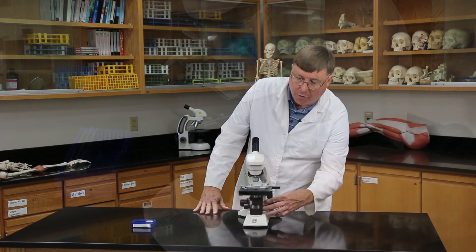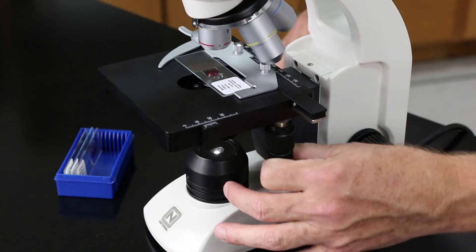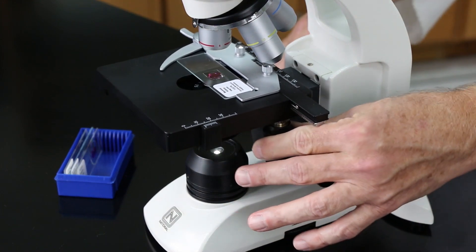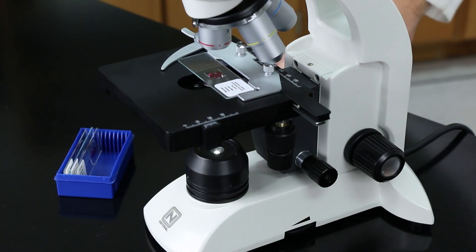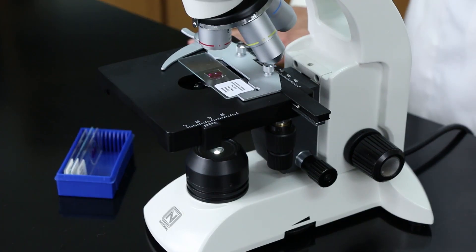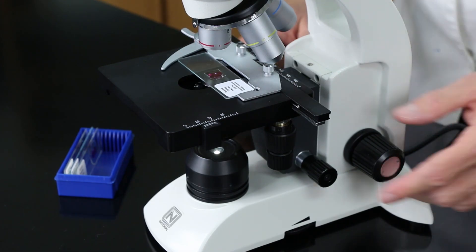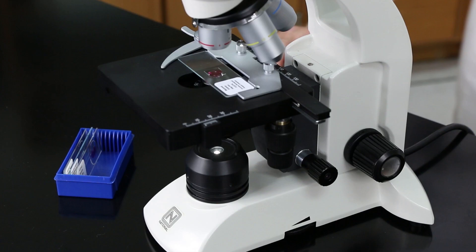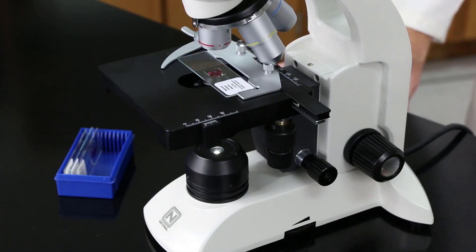And I can manipulate my slide by these knobs here. This knob will move it right and left. This one over here will move it up and down. And the other thing I want to make sure, and make sure you do have this on the scanning lens, I'm going to use the coarse focus and make sure that the stage is all the way up position.